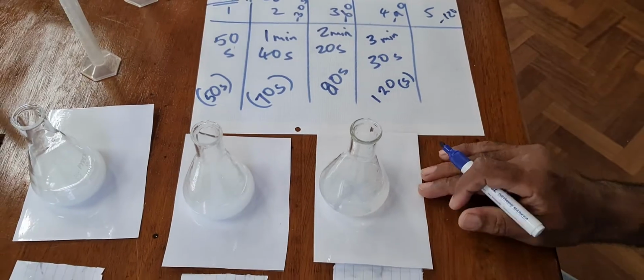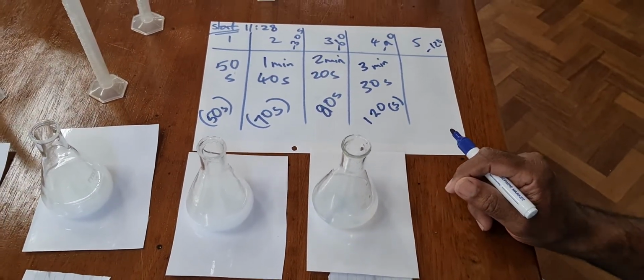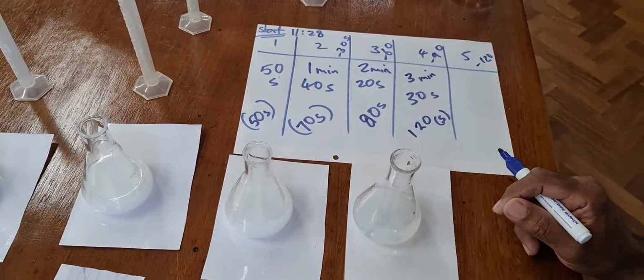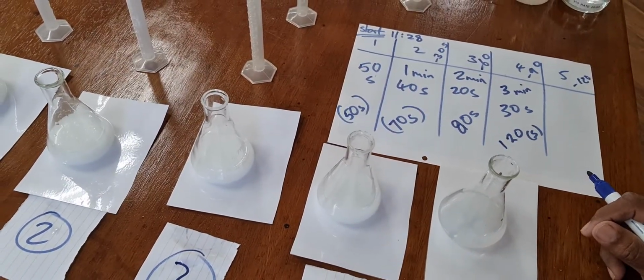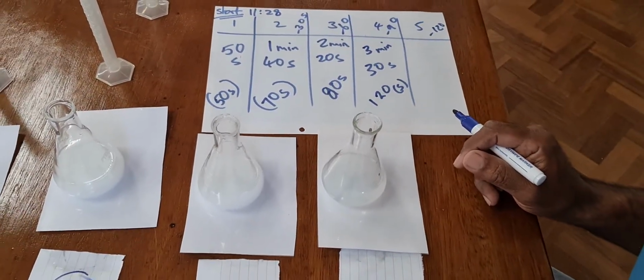Swirling it won't make any difference. Indeed, to be a fair test, I should not have swirled it. I'm sorry, just getting a bit impatient. One of the things to learn is patience, but I'm finding if I'm doing these videos, I'm more impatient when I'm recording than when I'm not.